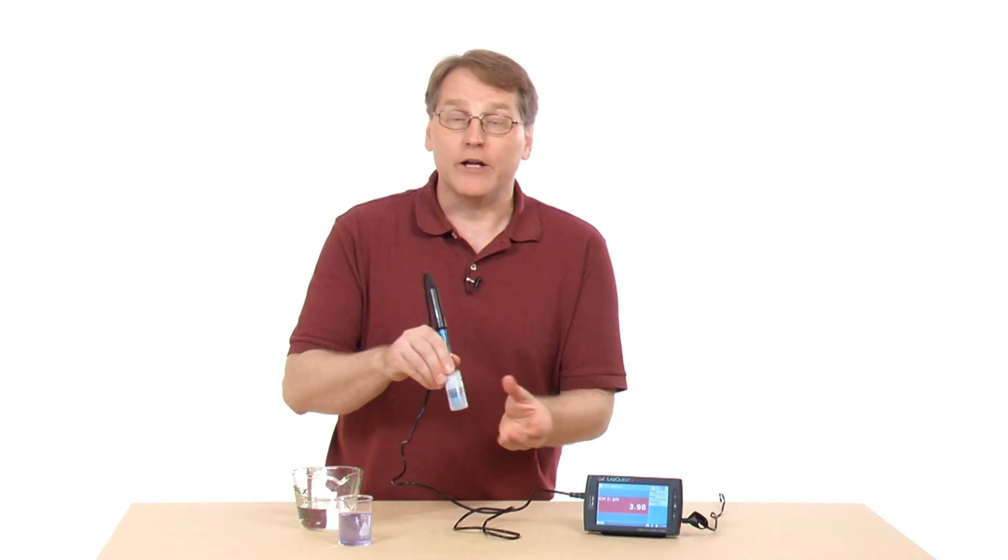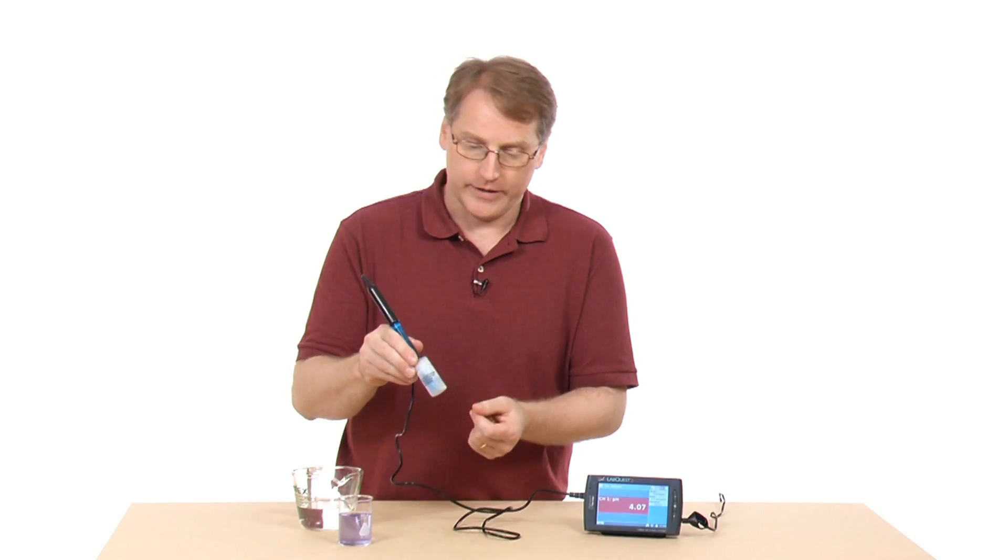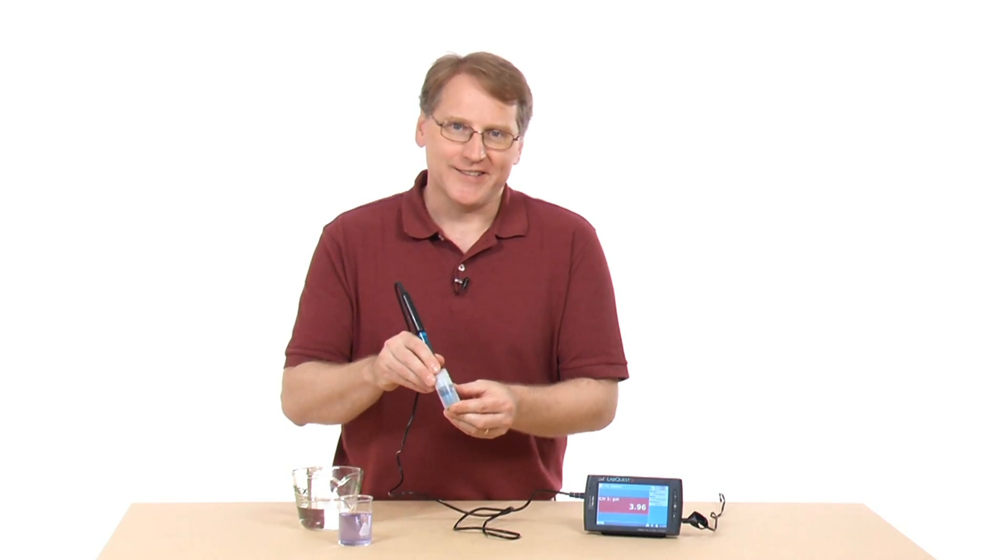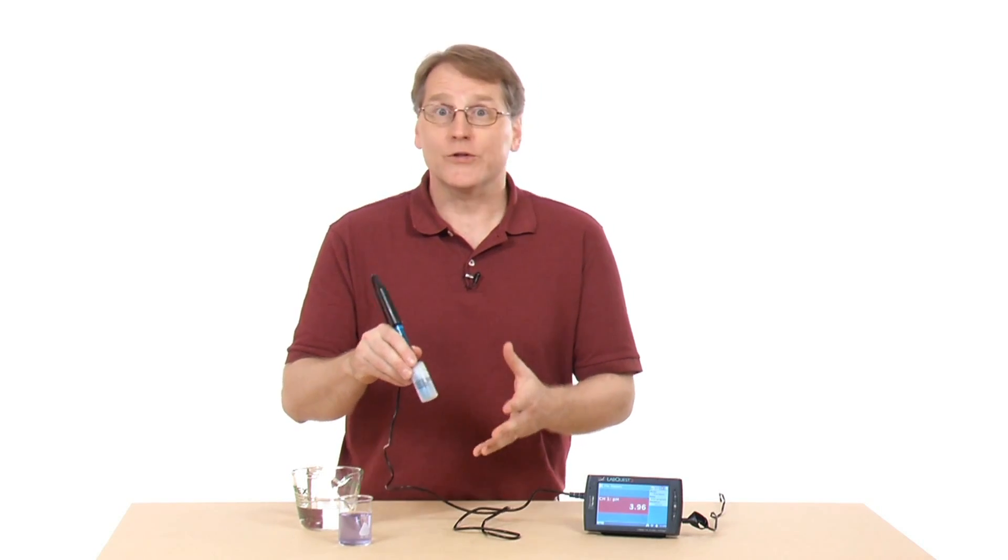Sometimes as these age, the values can shift a little bit, so maybe once a year you do calibrate. Another common question we get is, what's the pH of distilled water? People think it's going to be 7 because that's what the book says.